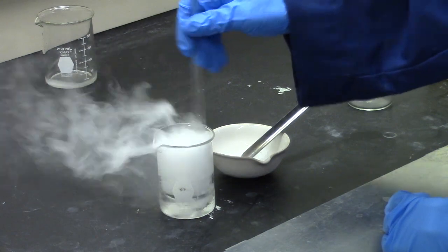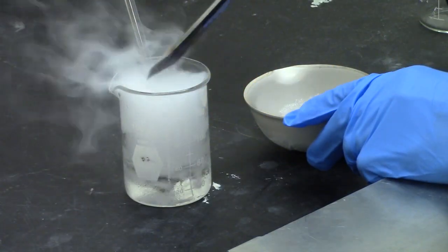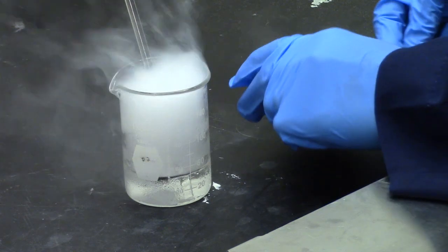As the solution gets warm, the sodium hydrogen carbonate will dissolve, for it is very soluble in water. Do not let it warm up.